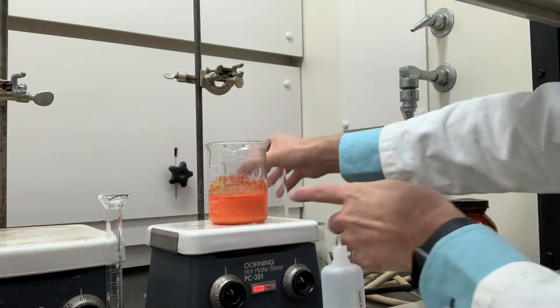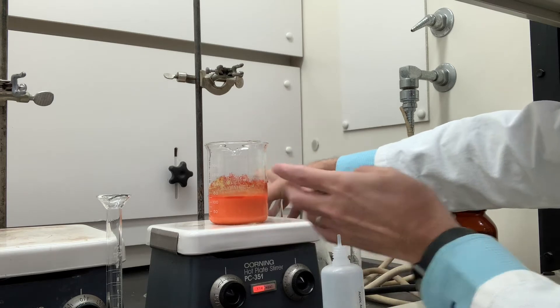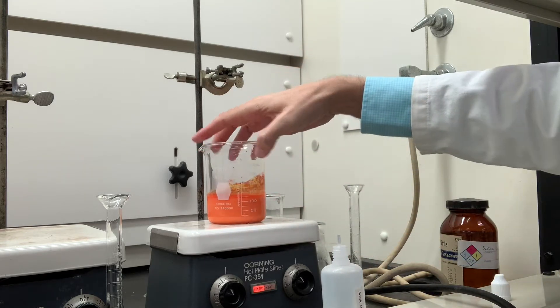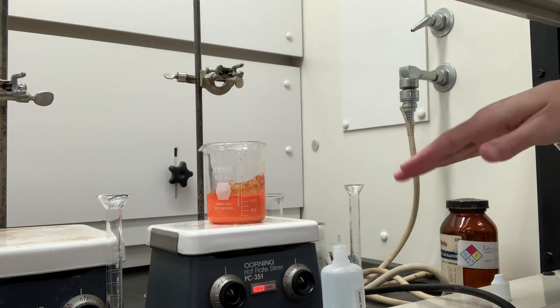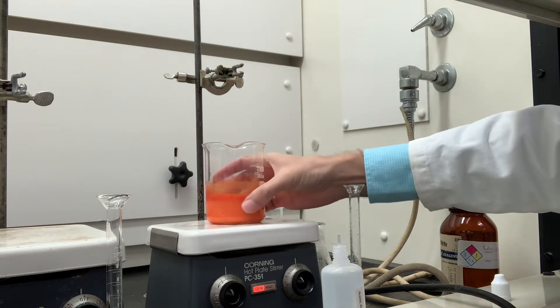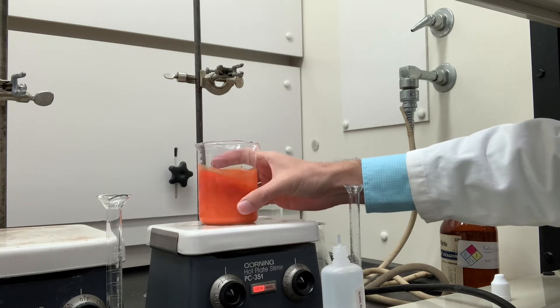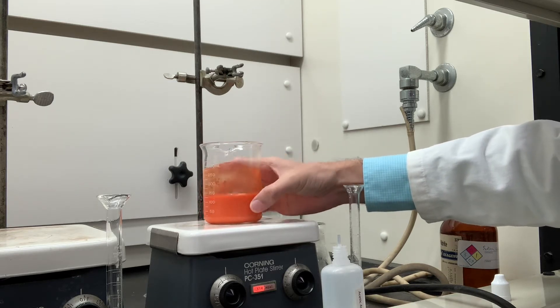Now keep in mind that there are still ice cubes in the reaction mixture rattling around in there, but we want to just let this stir for about 20 minutes at least. So I'm just going to turn the camera off here. There's not going to be too much to look at other than this orange suspension, which is what our methyl orange is.